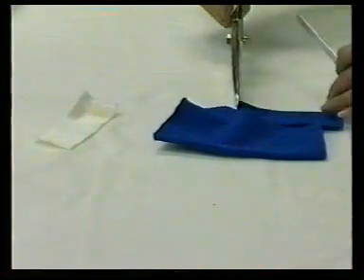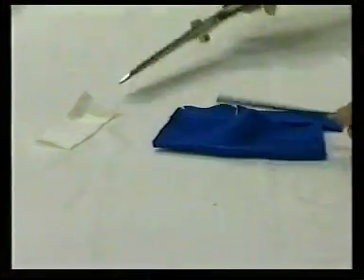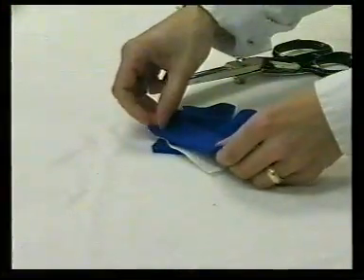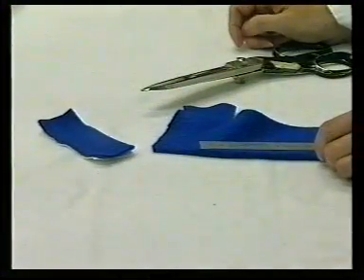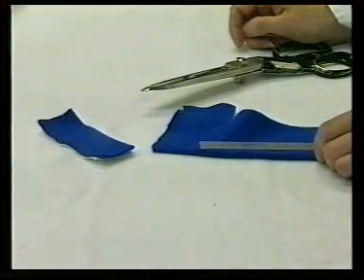A test specimen 100 x 40 mm is cut from the sample provided and attached to a similar size piece of multifibre strip.